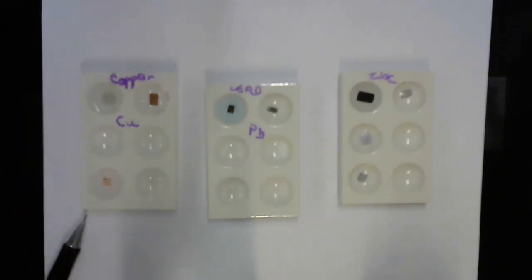And I am not seeing any precipitate, and I'm not seeing any bubbles. I can't stick my finger in there to see whether it's getting hotter, but I don't think I see a reaction there.